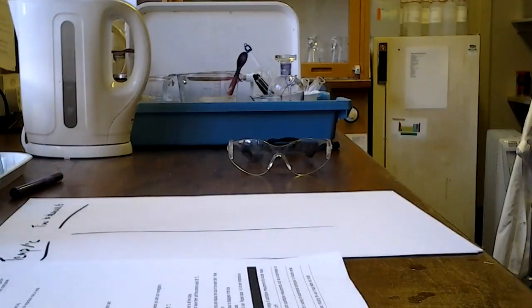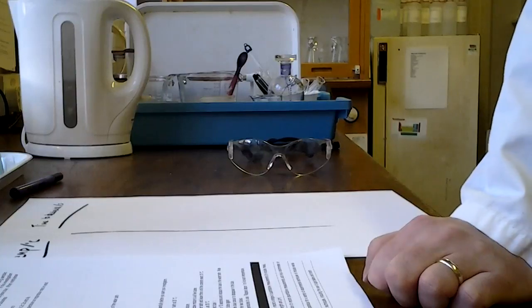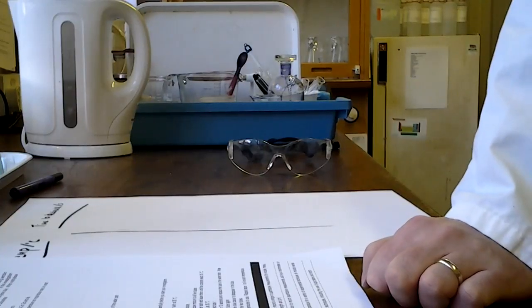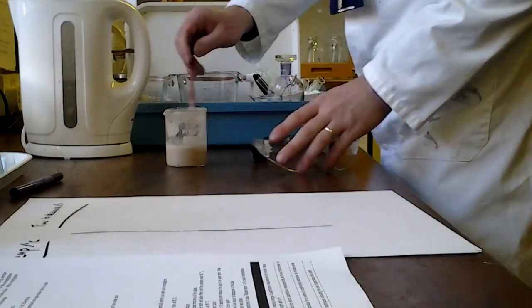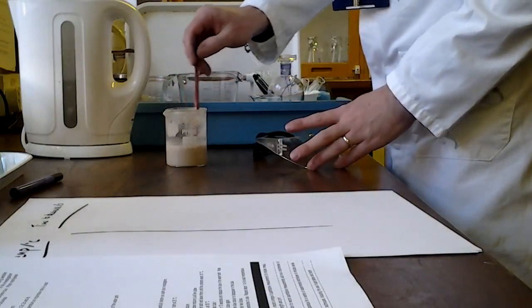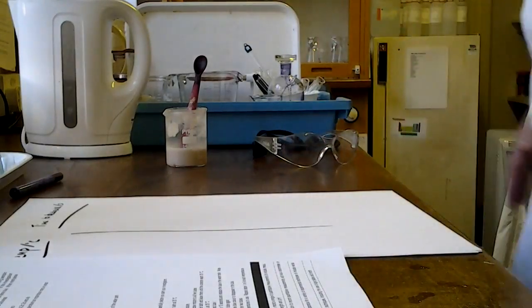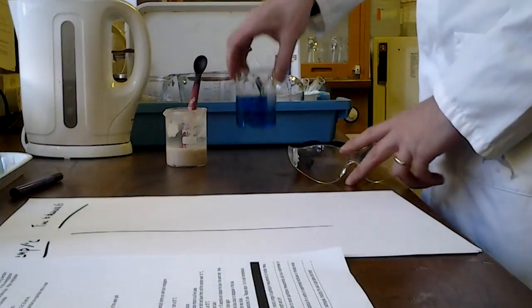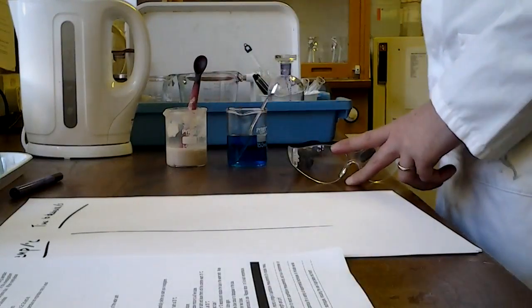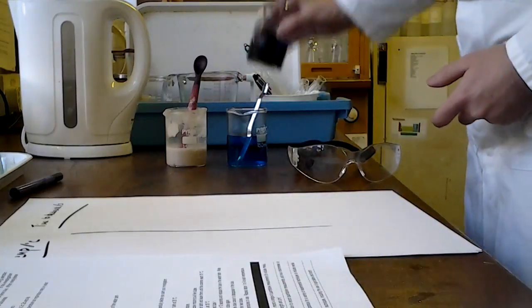Hello folks, this is Required Practical 9, which is an investigation of the effect of temperature on respiration in yeast. So here's some yeast, this is what we're going to be looking at, and we've mixed this yeast with a solution of glucose, so it's got some respiratory substrate, and we are going to be testing different temperatures to find out how it's respiring. We're going to measure this using a chemical called methylene blue, which is unsurprisingly blue at the moment. This is it in its pure form.